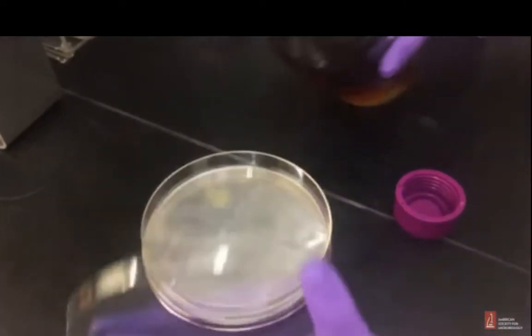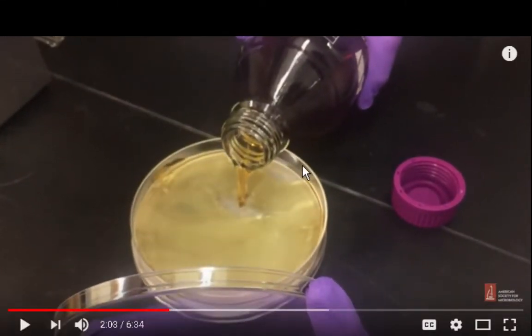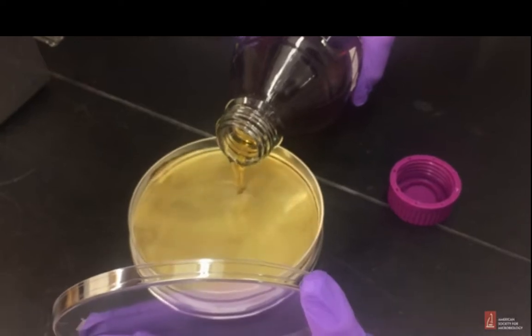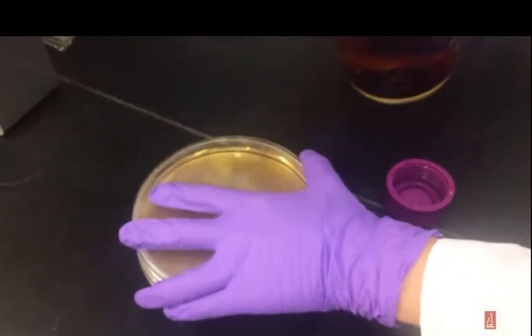Once the agar is ready to pour, hold it with one hand, and with the other hand, lift the lid. Pour the agar. Okay, now they're doing something here. They're pouring it really fast, that's one thing. And number two, the lid has not been sterilized. But that's minor because they're in a more sterile environment anyway. Slowly, make sure you don't form bubbles. Close the lid and wait for an hour for the agar to solidify.